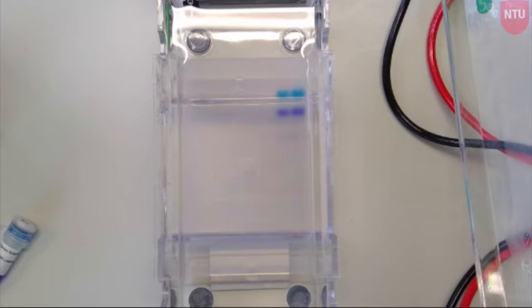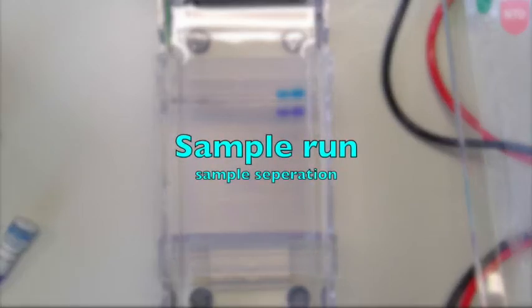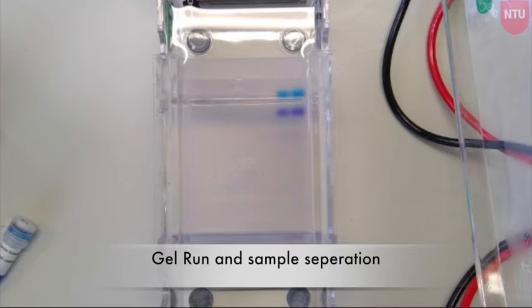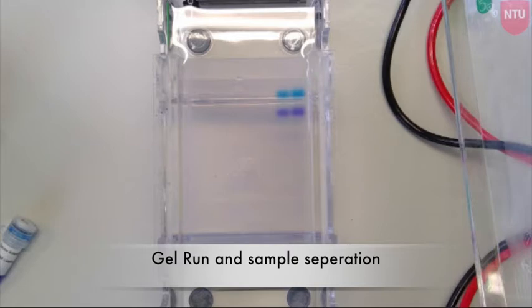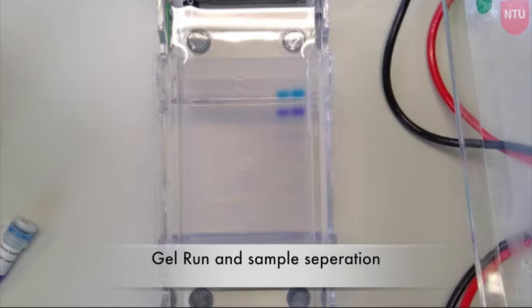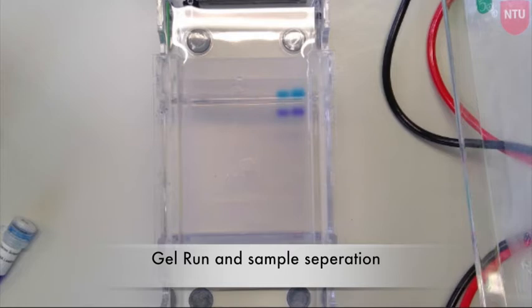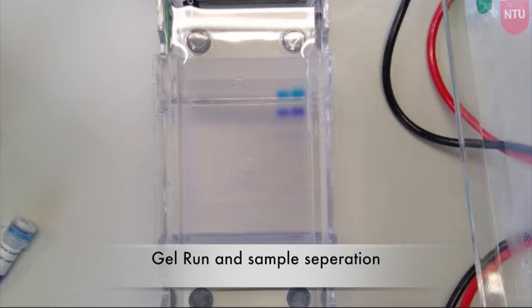The loading dye included in your gel will allow you to visualise the migration of your samples over time. You want to run the samples approximately three-quarters of the way along the gel for better resolution. This links back to the expected product size described in the worksheet. The longer you run the gel, the better the separation.